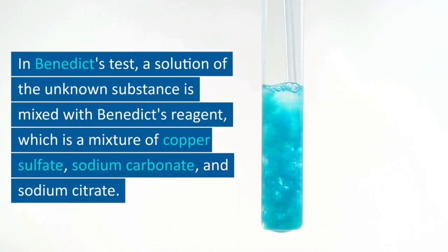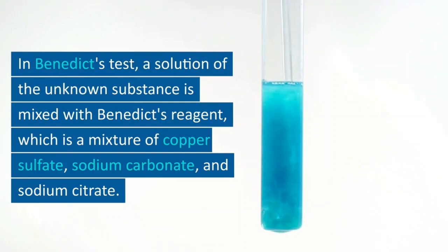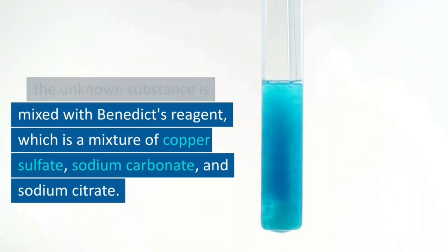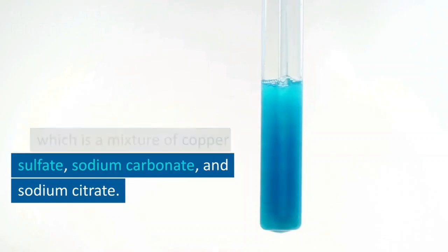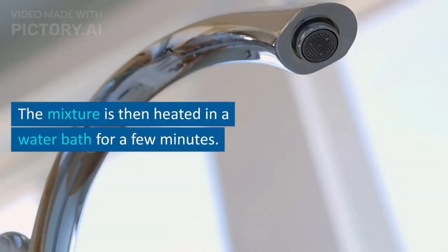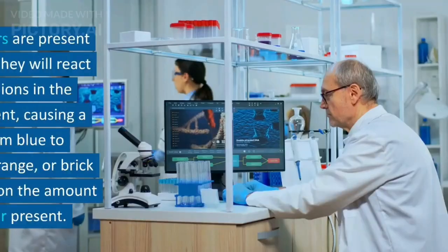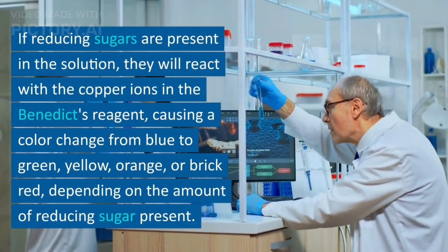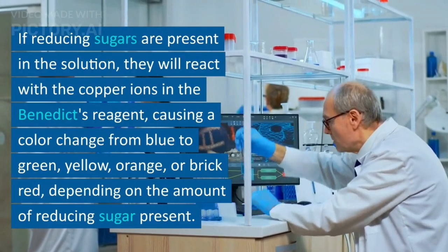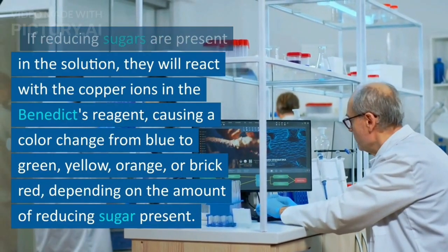In Benedict's test, a solution of the unknown substance is mixed with Benedict's reagent, which is a mixture of copper sulfate, sodium carbonate, and sodium citrate. The mixture is then heated in a water bath for a few minutes. If reducing sugars are present in the solution, they will react with the copper ions in Benedict's reagent, causing a color change.